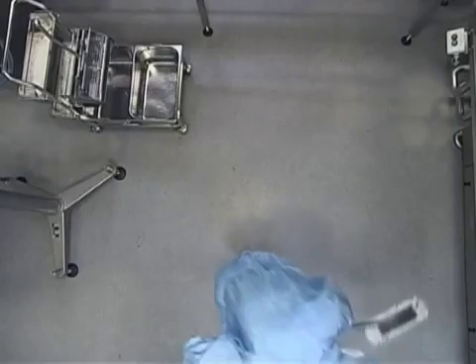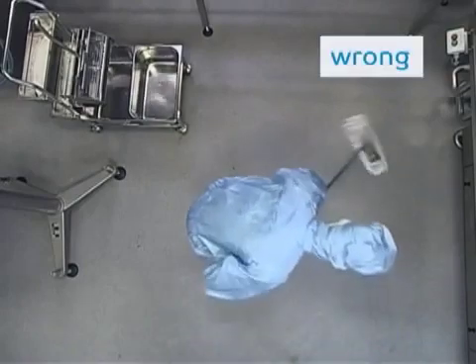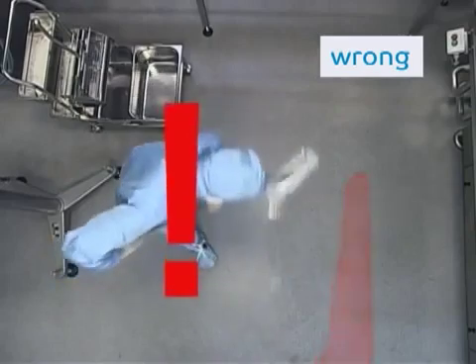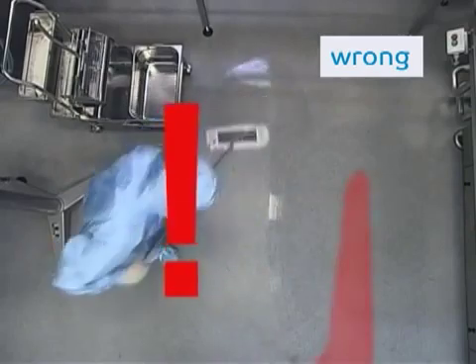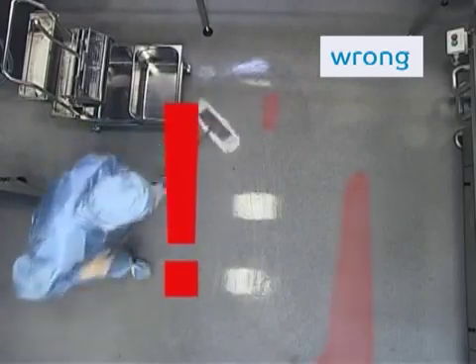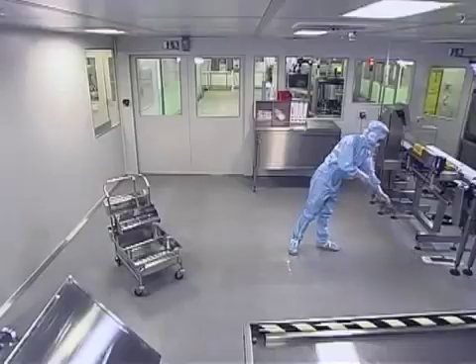How not to wipe can be seen here. Wiping gaps appear due to the inexactly performed figures of 8. Rapid wiping action can disturb the air, which causes unwanted movement of microorganisms and particles, so please take your time.